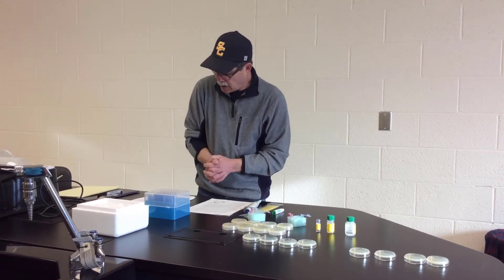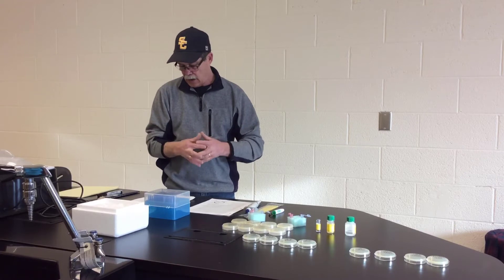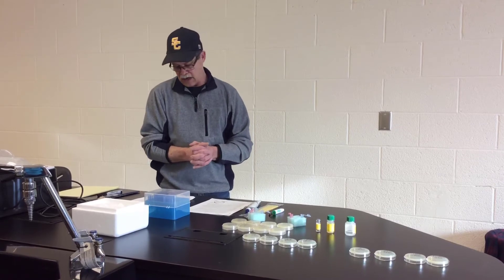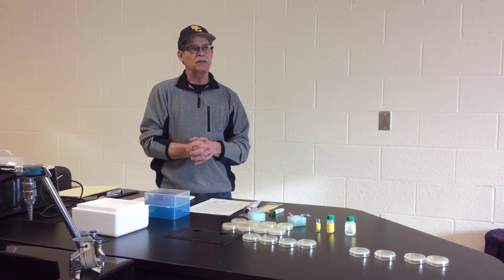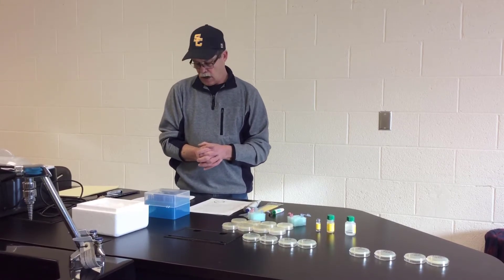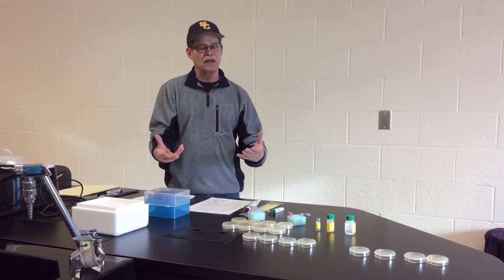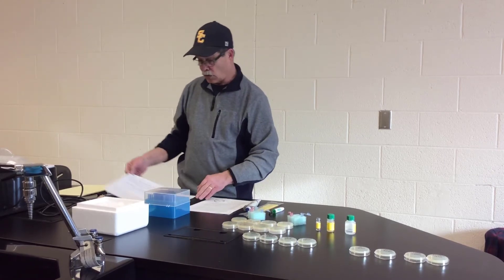Today, we're going to transform bacteria — specifically E. coli — with a gene that codes for the green fluorescent protein, or GFP. This GFP gene comes from the jellyfish Aequorea victoria. When this protein is exposed to UV light, it will fluoresce green, or glow green.